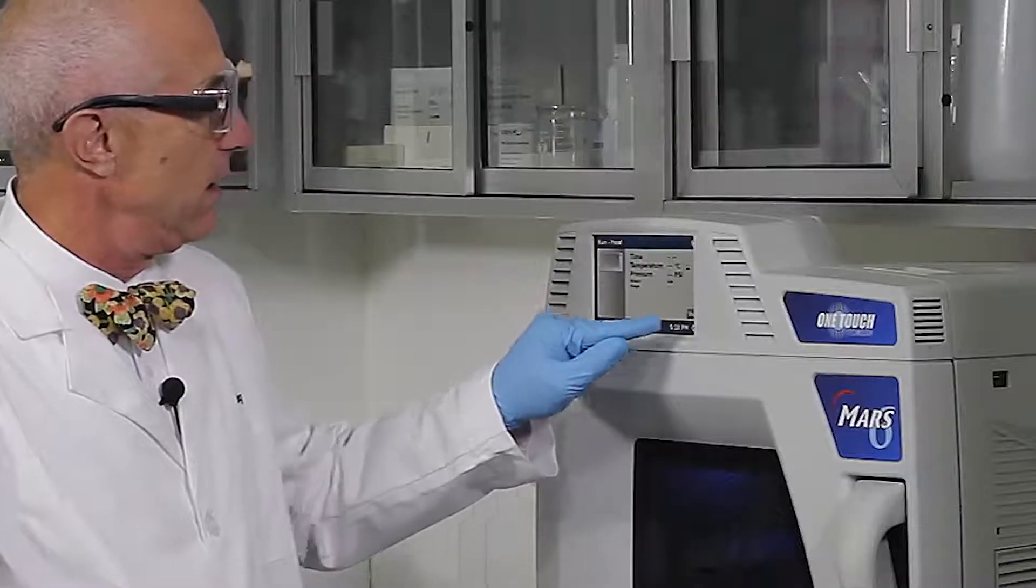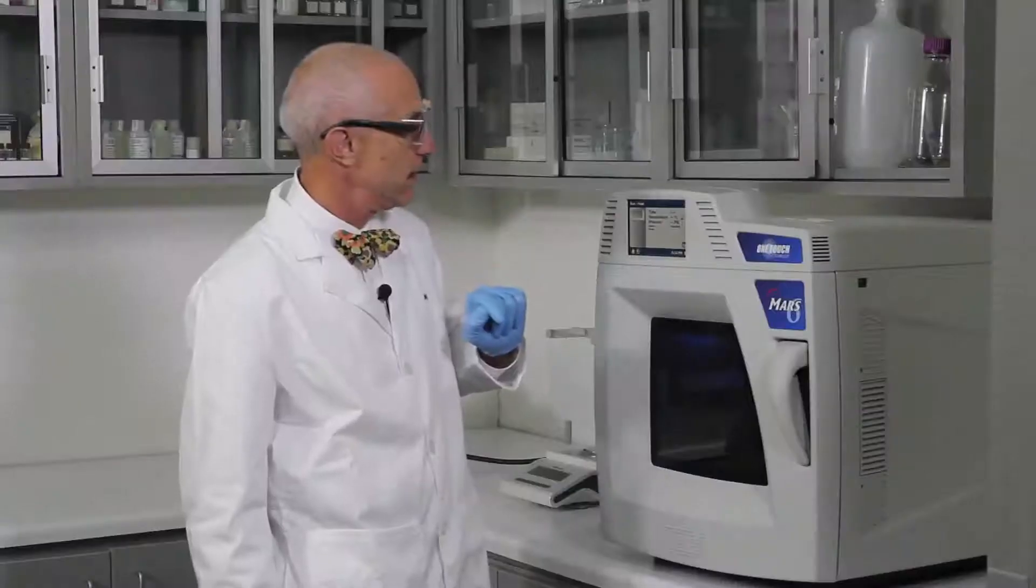Load the method and press start to start the digestion process.